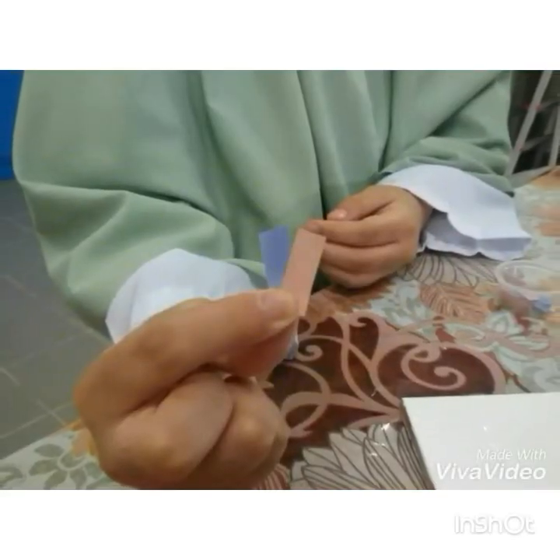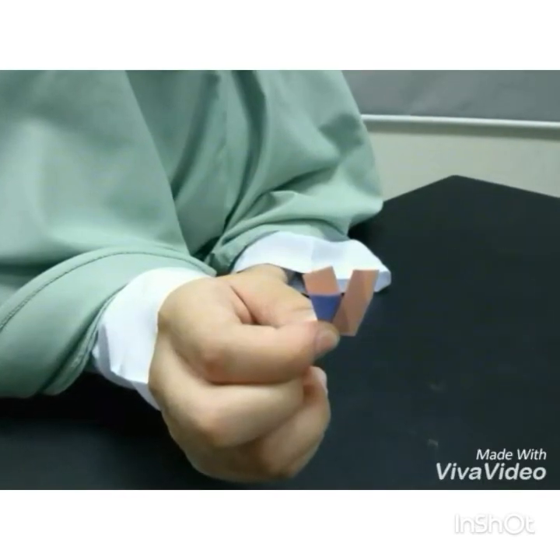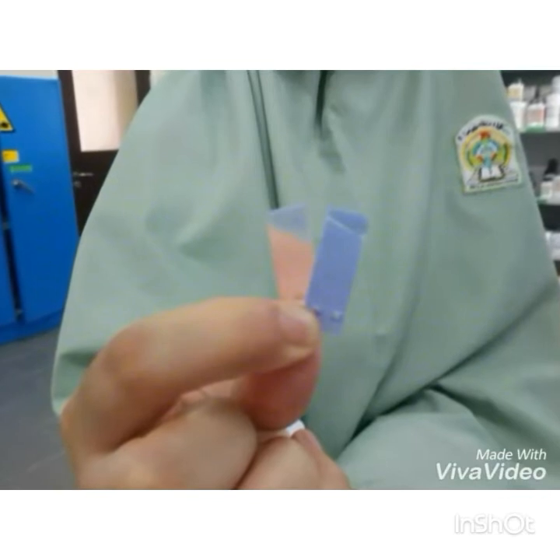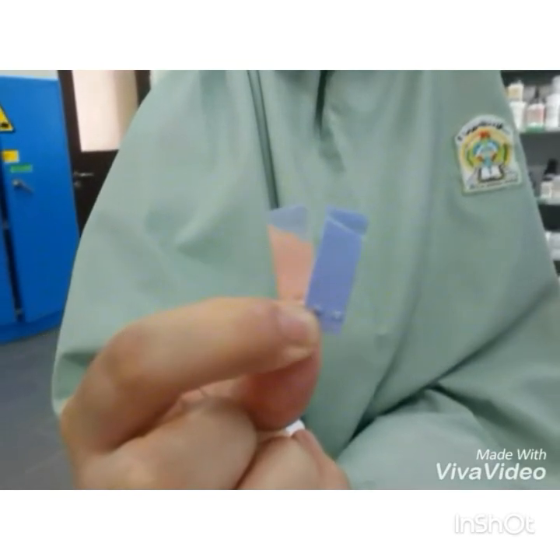So, in conclusion, we can see that acids turn blue litmus paper into red color and red litmus paper stays the same, and bases turn red litmus paper into blue color and blue litmus paper stays the same color. And that's all from us.